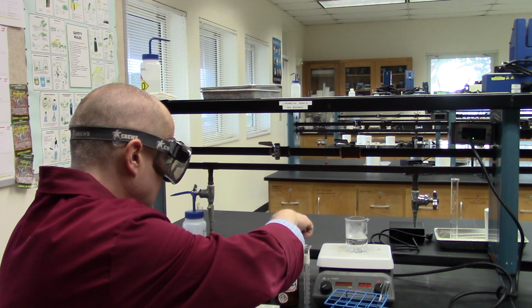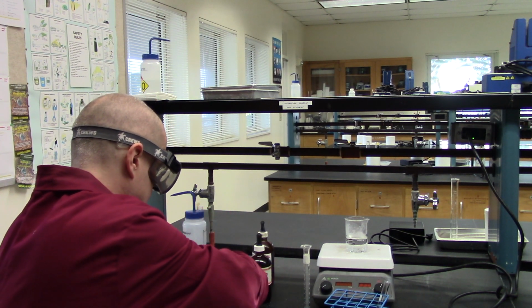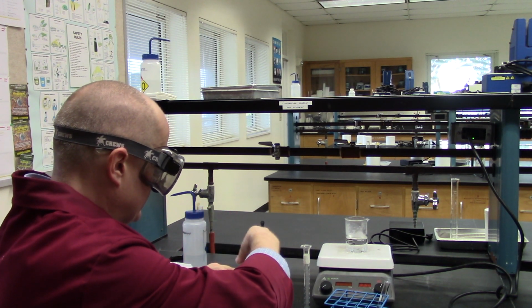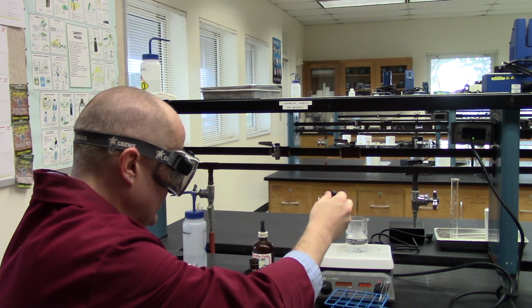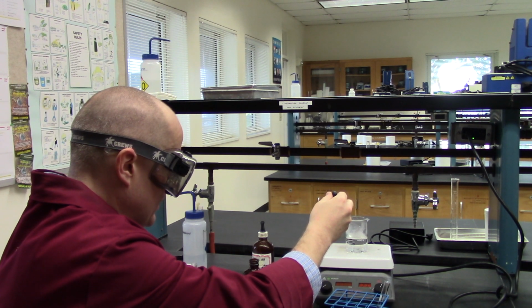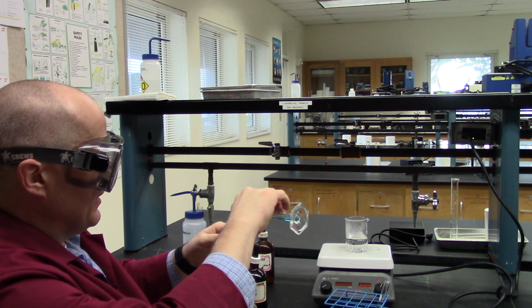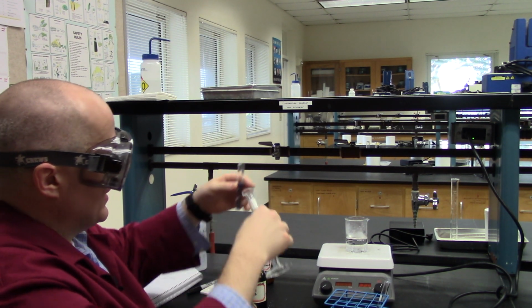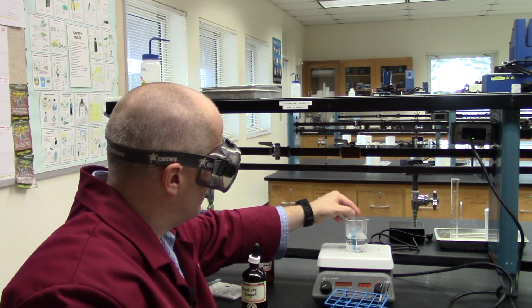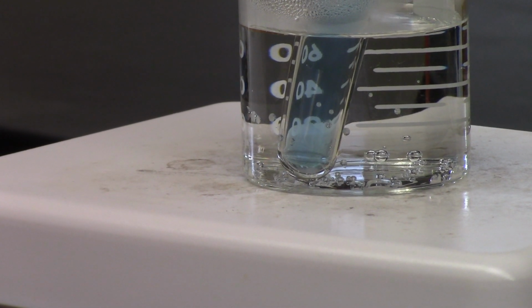Let me get rid of this bottle here. Get that out of the way too. About a mil. It doesn't have to be too accurate, but about a mil. All right, so put a milliliter in here. And then put that back in the water. The water is nice and hot, so this shouldn't take very long. I'll make sure my other camera's picking that up. All right, very good.